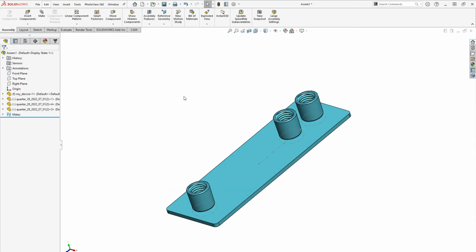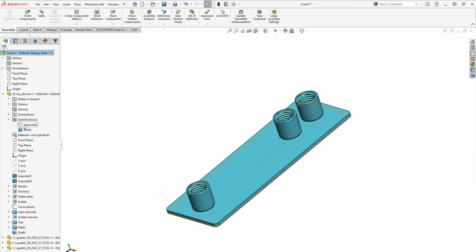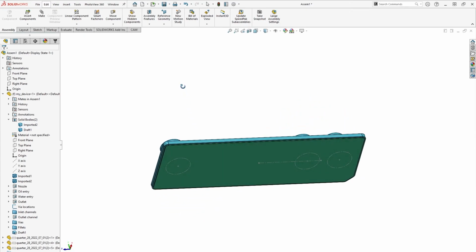Alright, all the ports are now in place. Let's show the capping layer that we hid at the beginning of the exercise by expanding the fluidic layer in the feature tree, right-clicking on the solid body, and pressing the eye icon to show. Okay, now our CAD is all wrapped up. We've got a solid design that matches our original schematic and is ready for manufacturing. Now, all we need to do is actually get it fabricated.